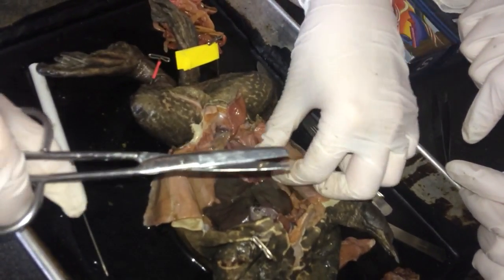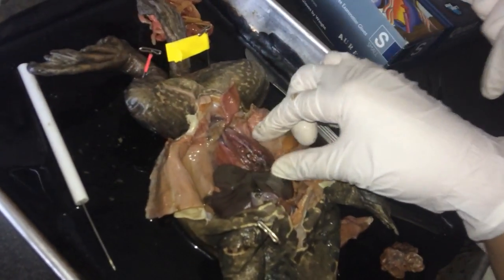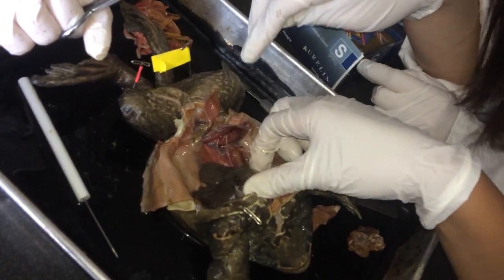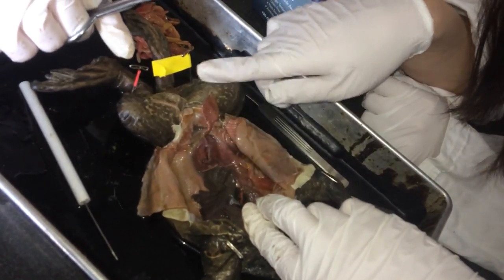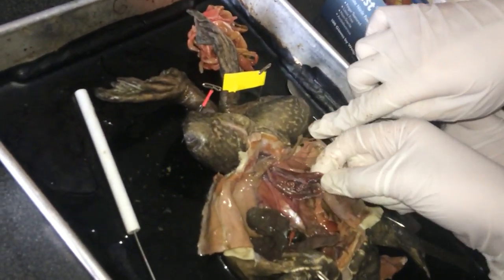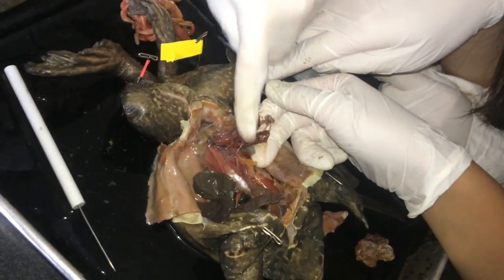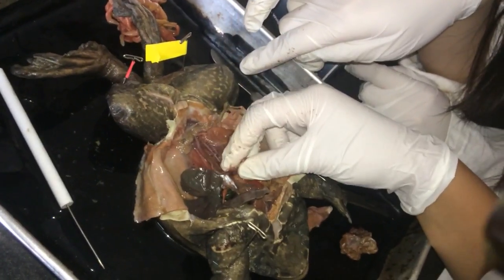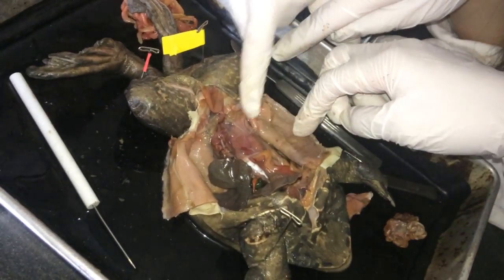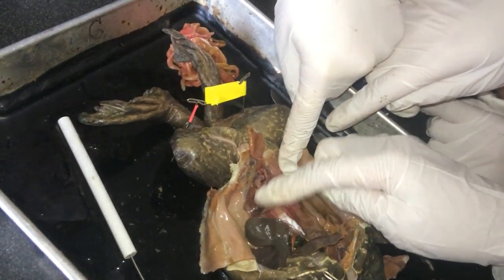Those have to be... Would you call this flat and bean shaped? Yeah. Are those kidneys? I think so. I think you've got the lower back, near the spine. They're often a dark color. Oh, oh, oh — they have yellowish, stringy bodies attached. Yeah, maybe. I guess this frog has no gender. Well, for the guy — they have fallopian tubes. Yeah, maybe these are the kidneys.